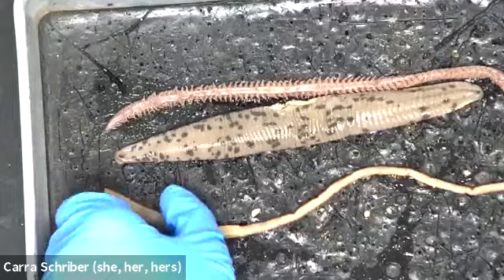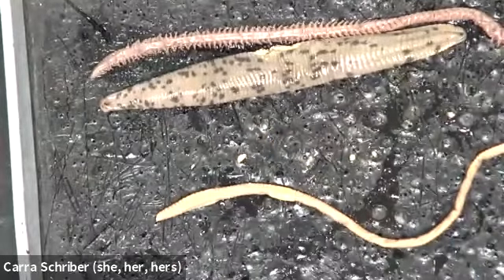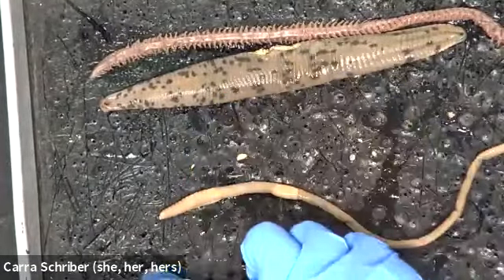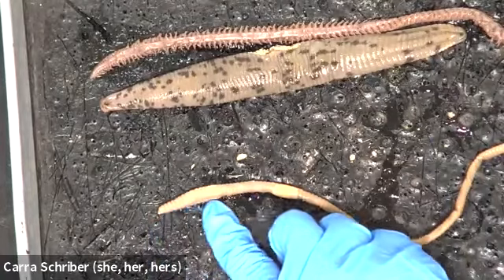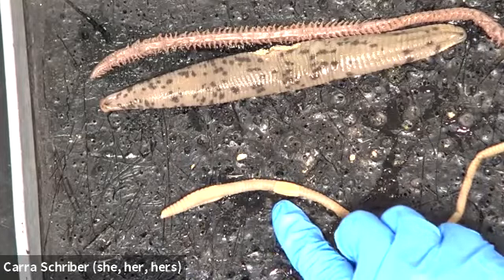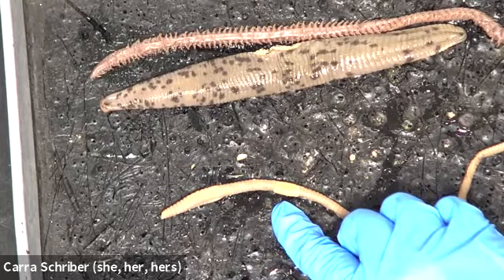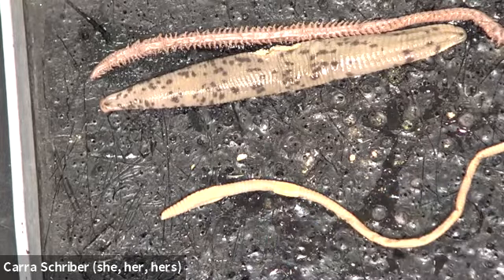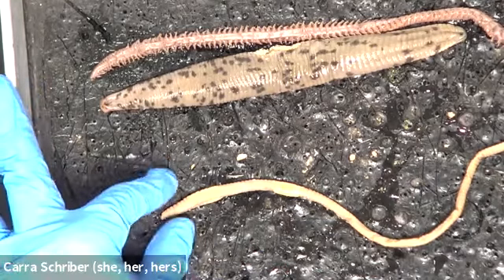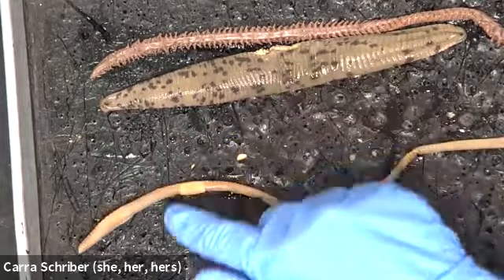I just want to come back to our earthworm one more time. When we're looking at an earthworm, and I'll talk more about this when I do the dissection, at the front, I know that this is his mouth because there's this organ here. See how it bulges out a little bit right there? That's the clitellum, and that's actually a reproductive part of the earthworm, and we're not going to go into that for the purposes of this lab. But you can always tell where the earthworm's mouth is going to be with where the clitellum is, because it's always skewed here.